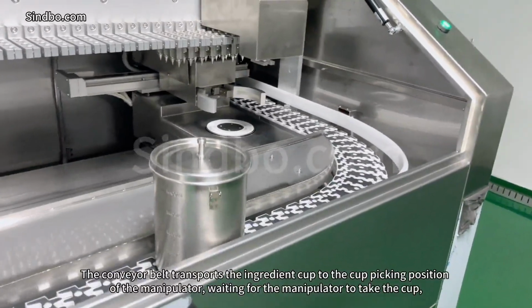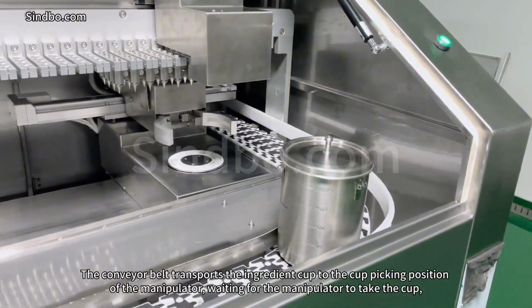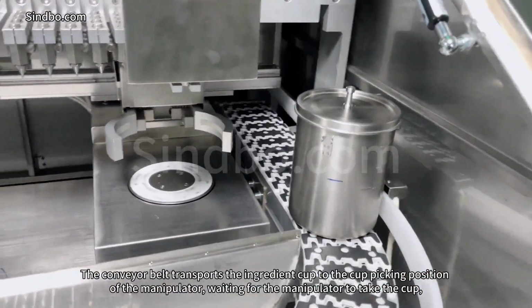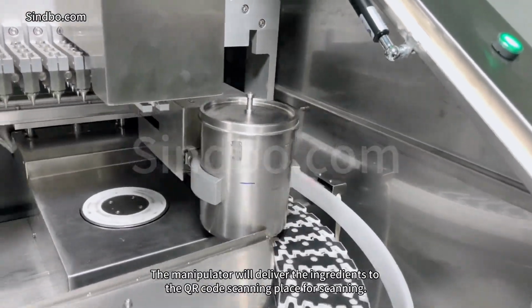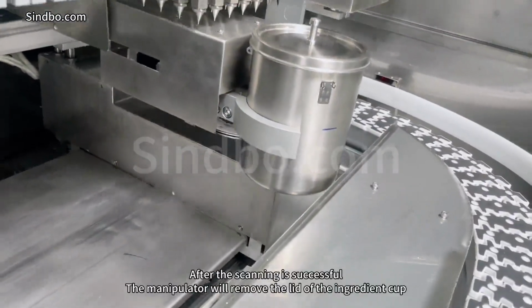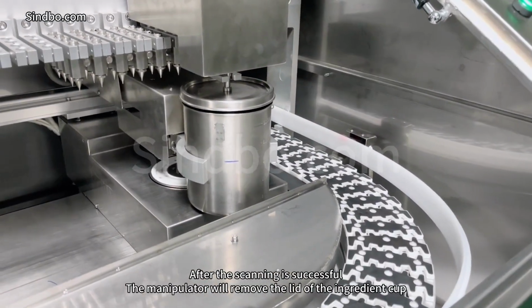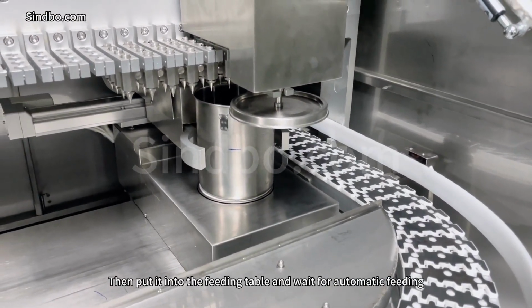The conveyor belt transports the ingredient cup to the cup picking position of the manipulator, waiting for the manipulator to take the cup. The manipulator will deliver the ingredient cup to the QR code scanning place for scanning. After the scanning is successful, the manipulator will remove the lid of the ingredient cup, then put it into the feeding table and wait for automatic feeding.